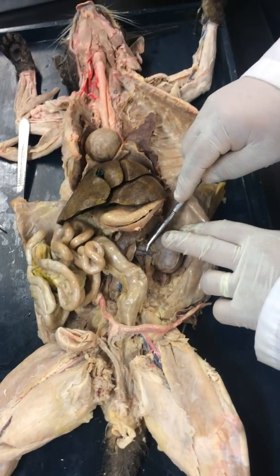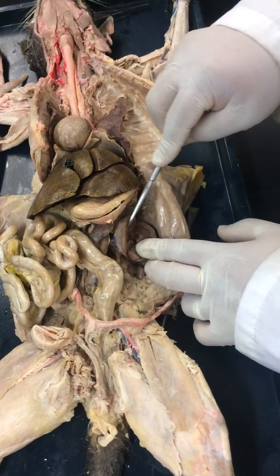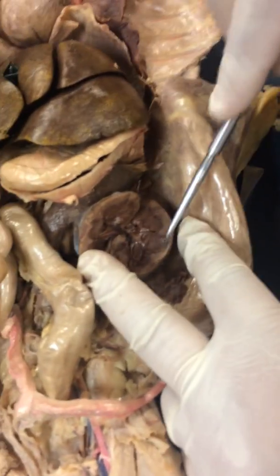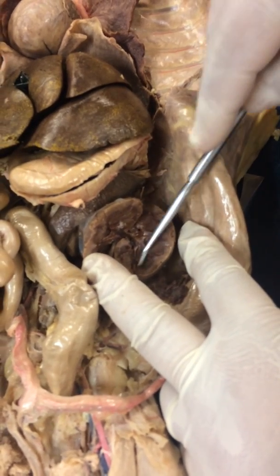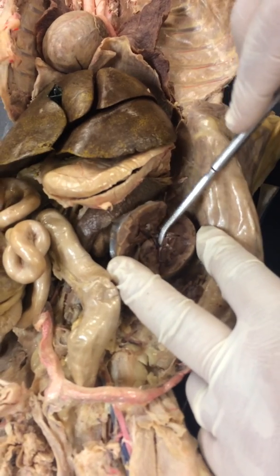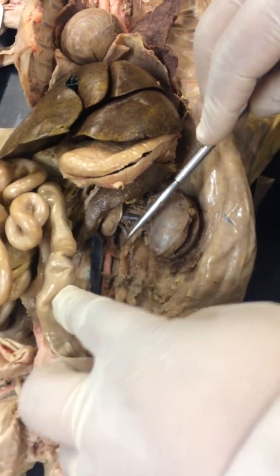Your renal veins and renal arteries are right here. Right? So if we open up the kidney, you will see the three regions: the renal cortex, the outermost; the renal medulla with the renal pyramids there; and then the deepest region here, the renal pelvis. Now from the pelvis, you're going to drain that urine into the ureters.